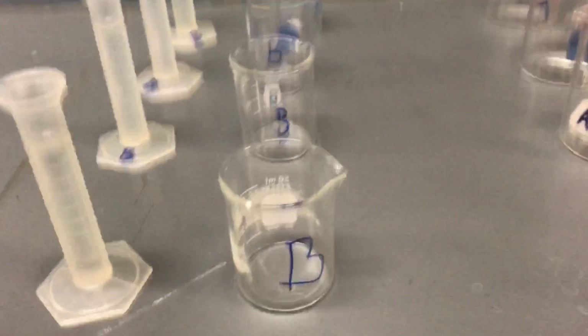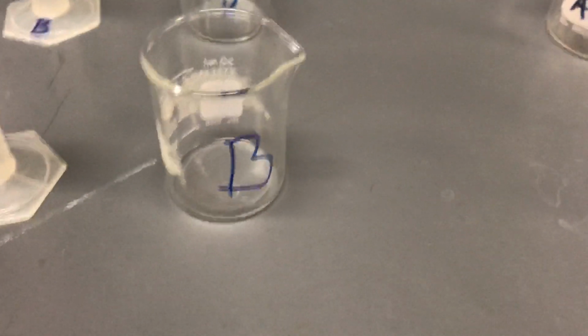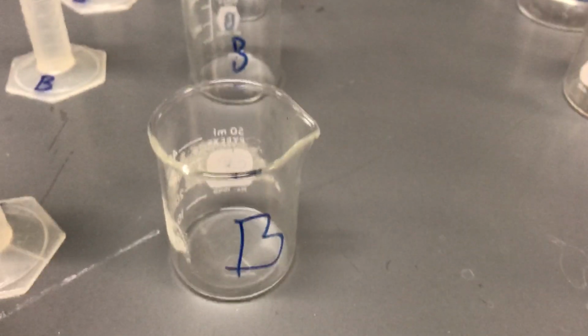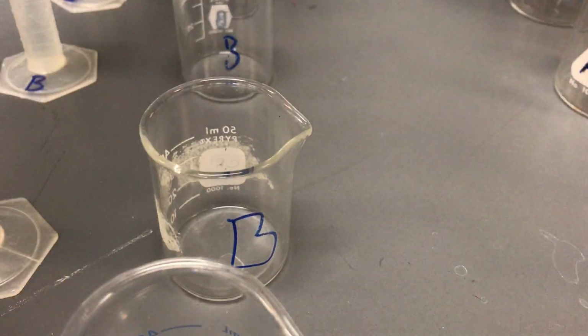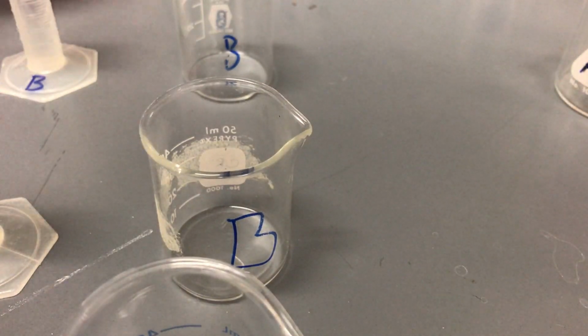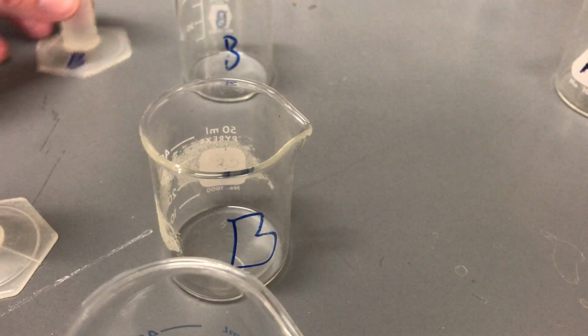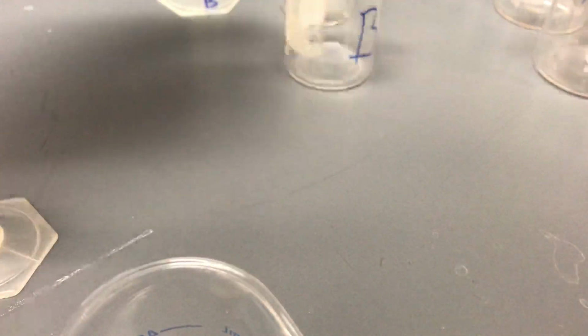So I'm going to just set the phone down here and hope that it doesn't fall over. And we'll give ourselves some space. I'm going to move these all back a little bit just so we have a little room and make sure we're doing things appropriately. And we're going to do one at a time. And so we have our 3 sets, and 4th and 5th, and then finally our first.